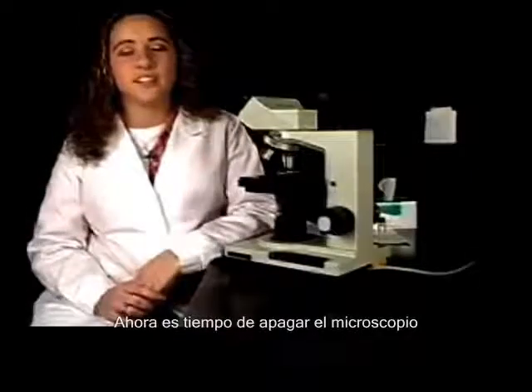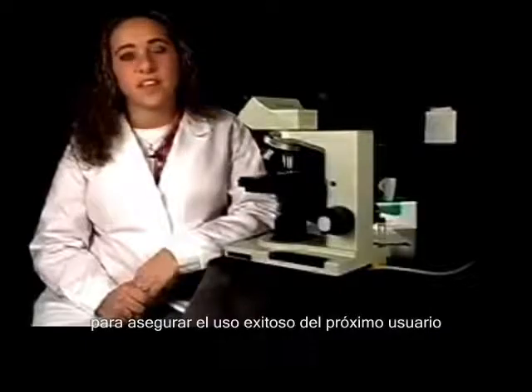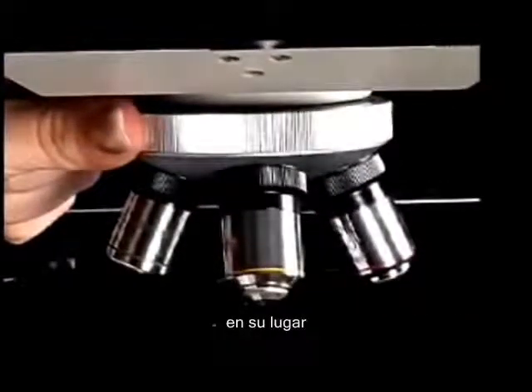It's now time to shut down the microscope. But before doing so, there are a few things you need to do to ensure the success of the next user. First, you're going to make sure that your 4x objective is in place.